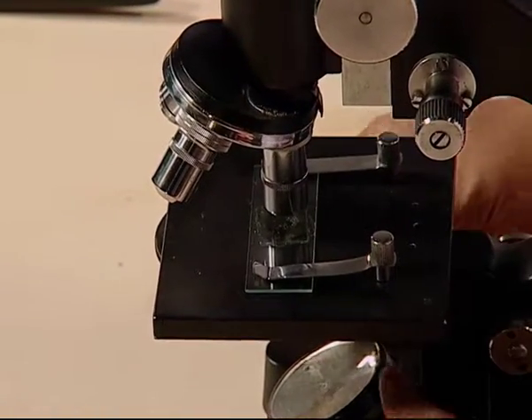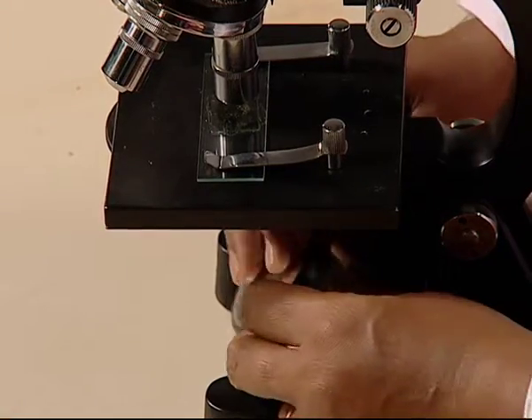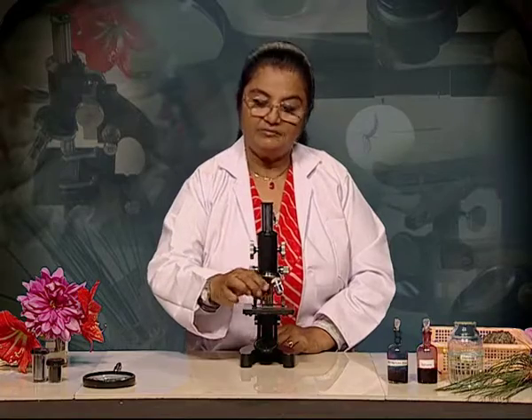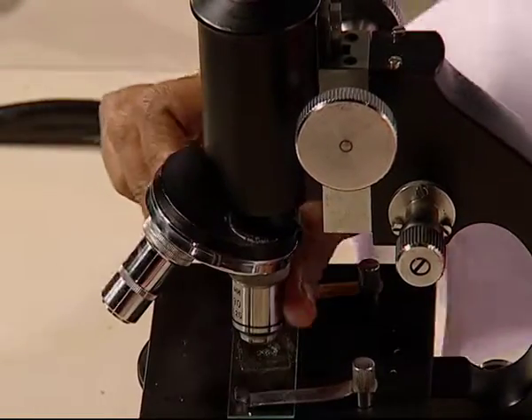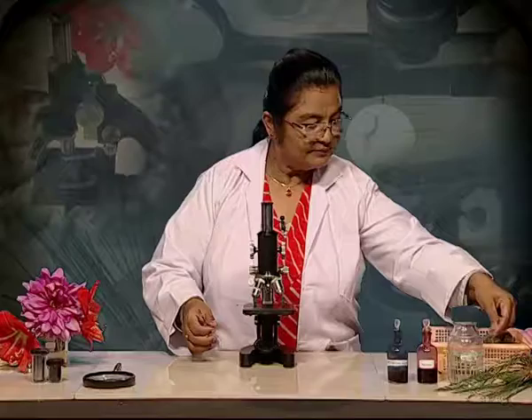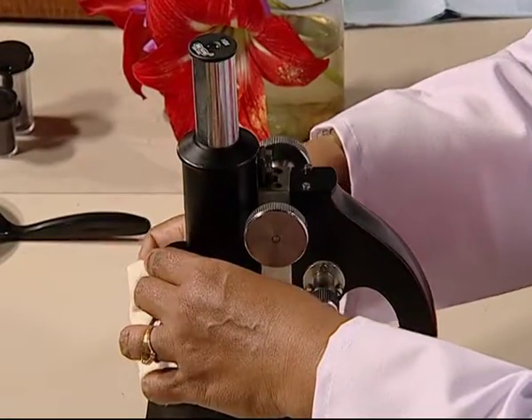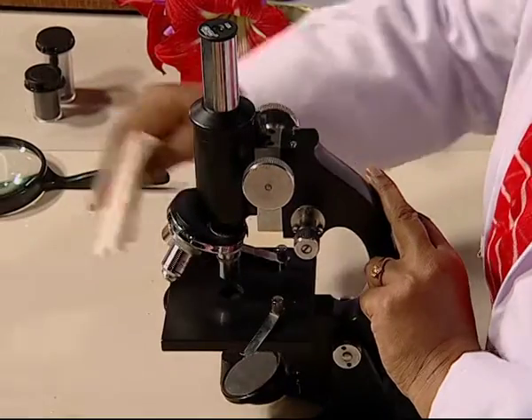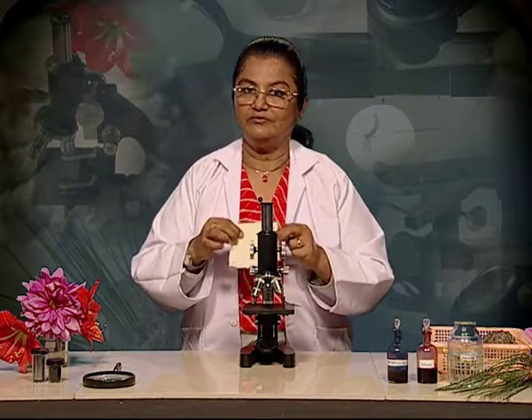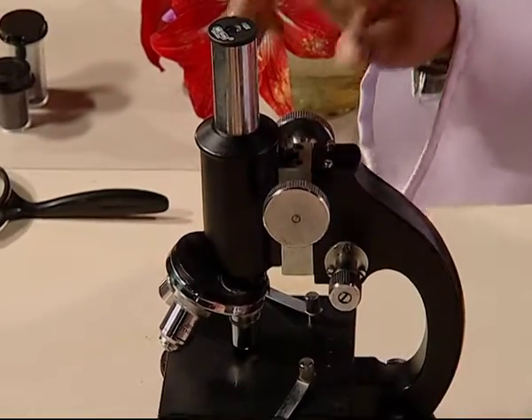Do not allow direct sun rays to strike the mirror. Use the plane mirror side for natural daylight and concave mirror for artificial light. When you are done, first bring the low power above the object. Remove the glass slide. Wipe the lens and stage. Use only lens cleaning tissue for cleaning, not any rough cloth. After use, lower the body tube so that the microscope fits into its box.